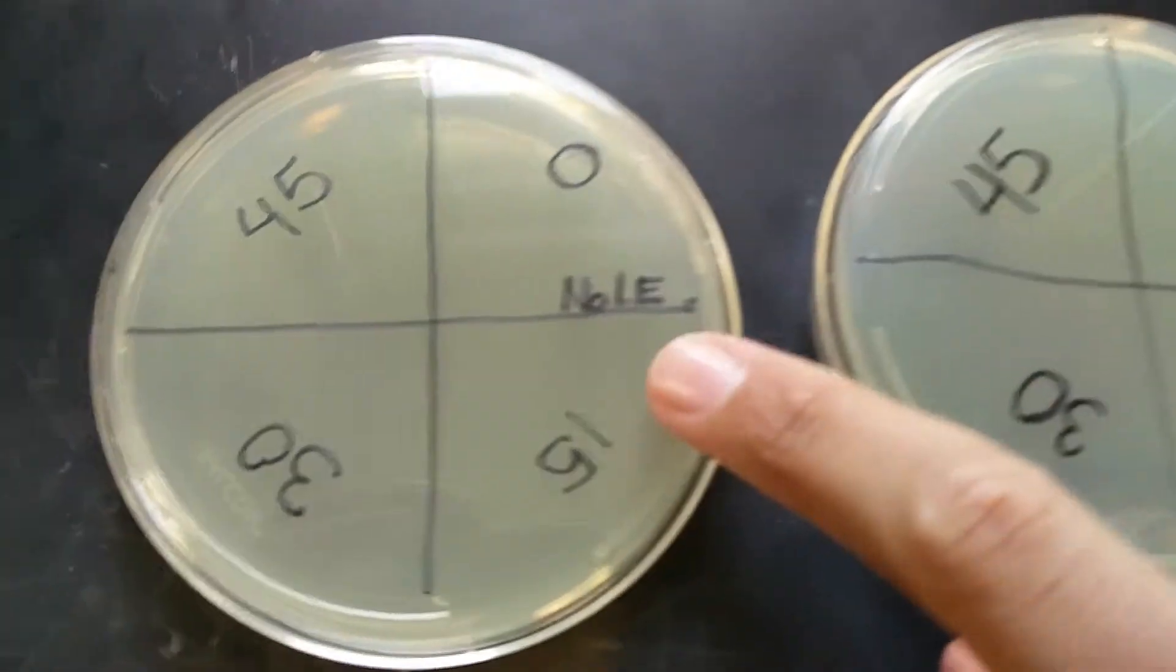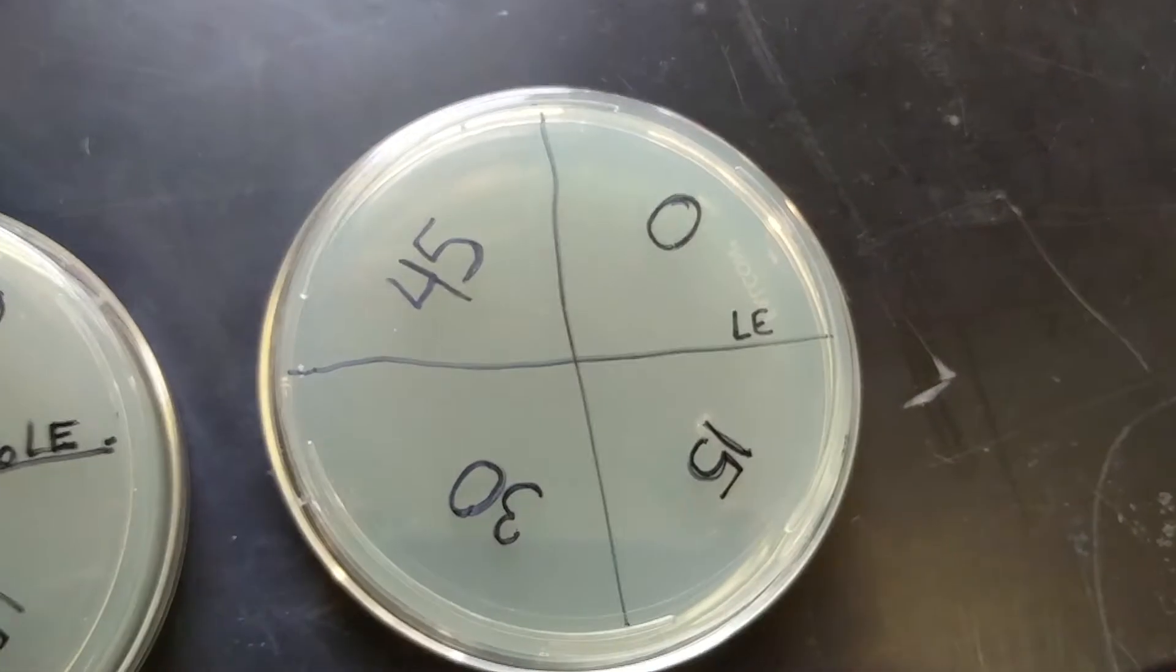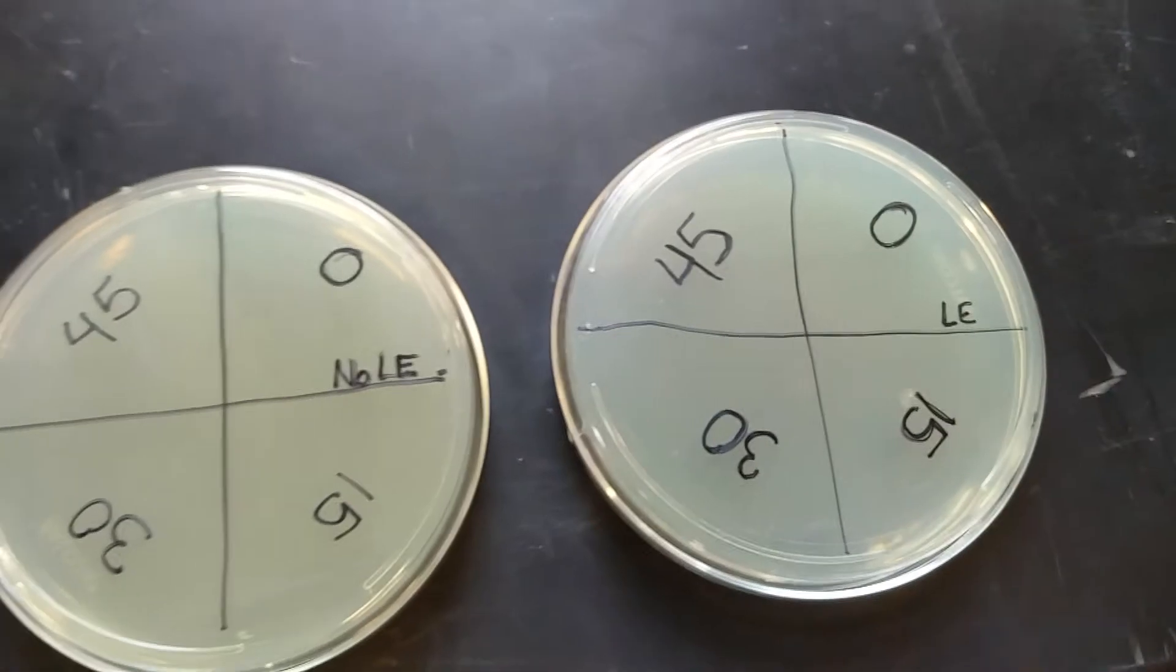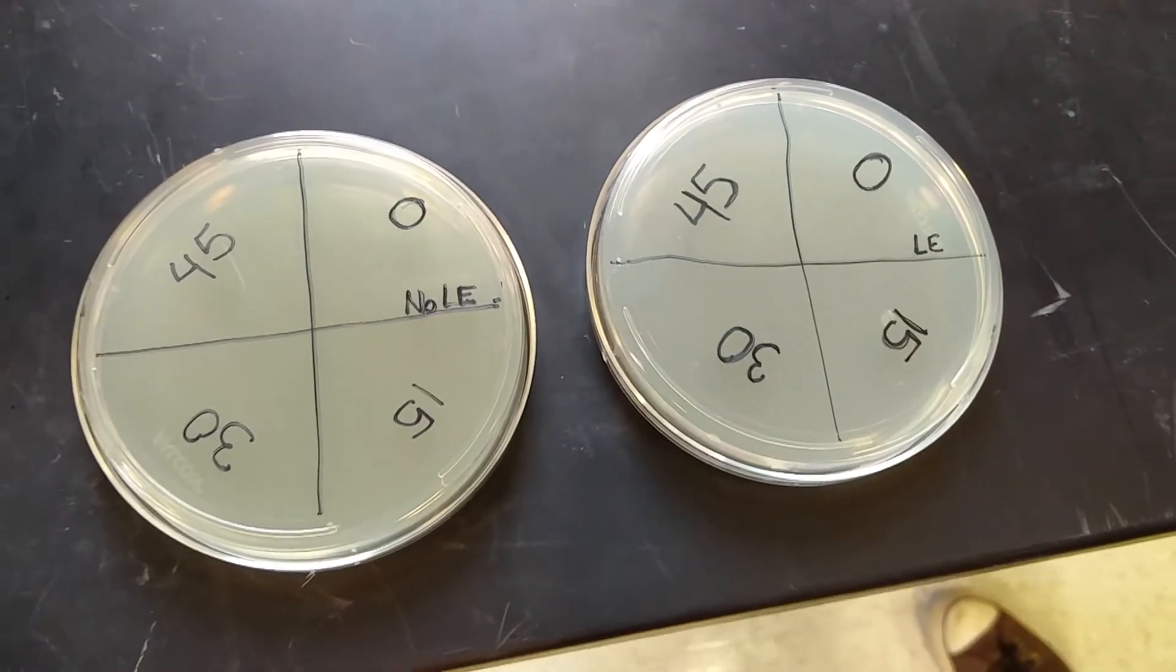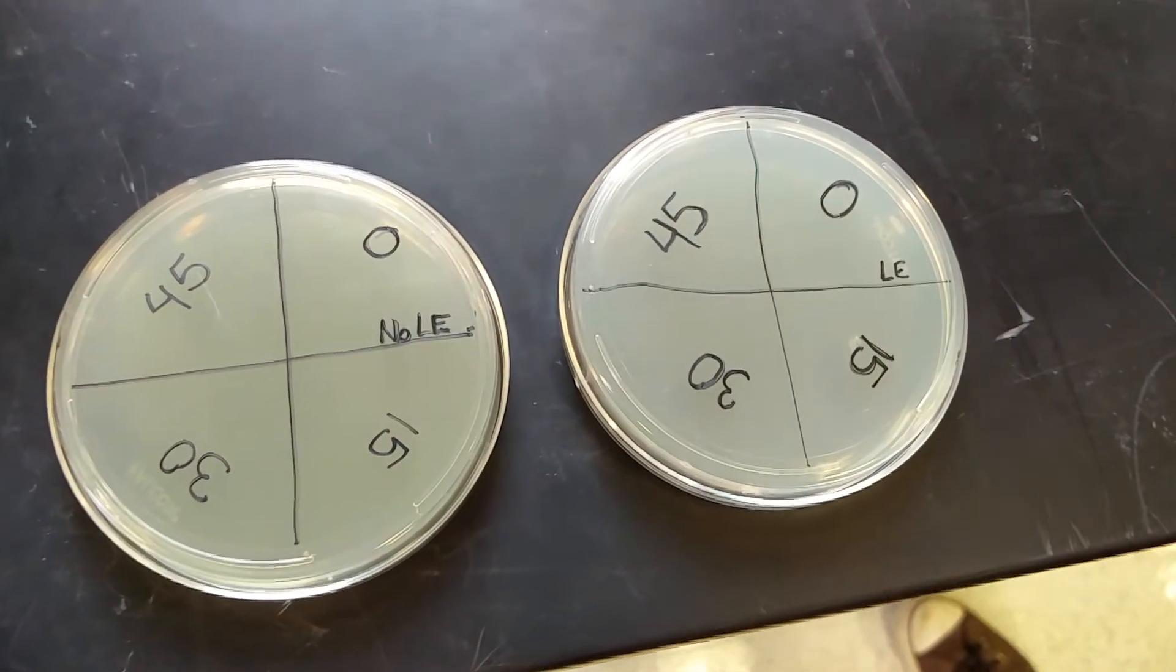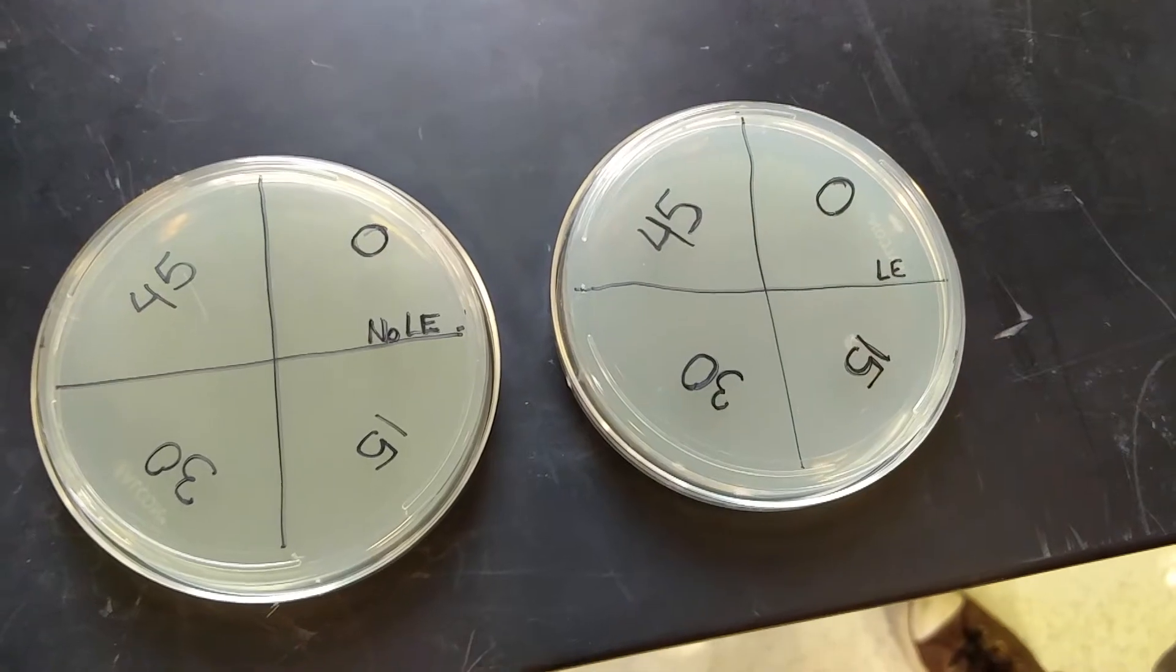Then after that you write either no LE or LE, which stands for light exposure. This means that if you have LE, then you'll be exposing it to visible light or sunlight after you expose it to the UV.